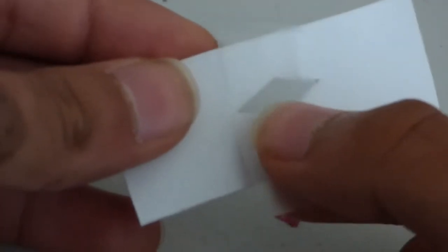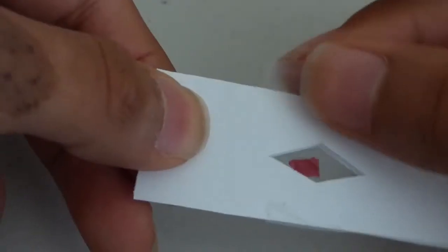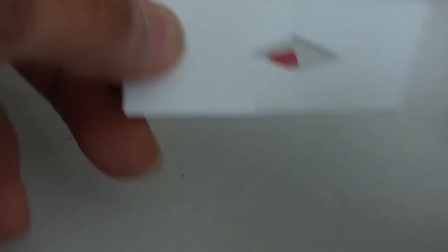I've gathered two pieces of tape, one of which I'm using on the front side. Flipping it over, I'll take my sample and stick it on the piece of tape.